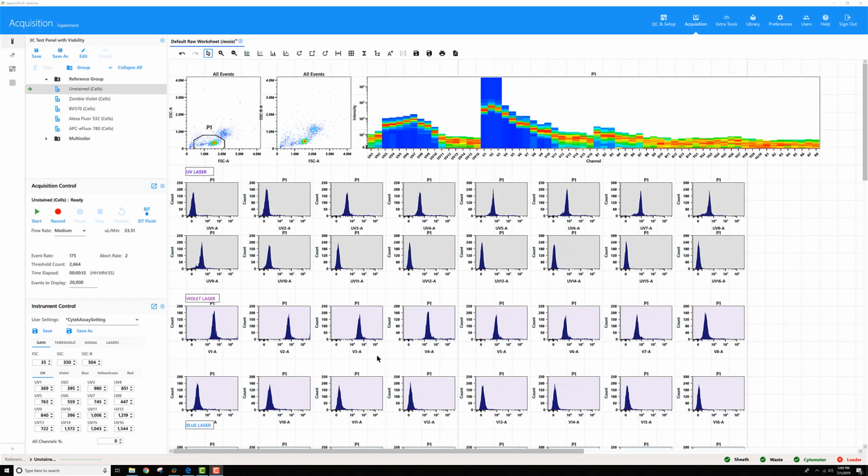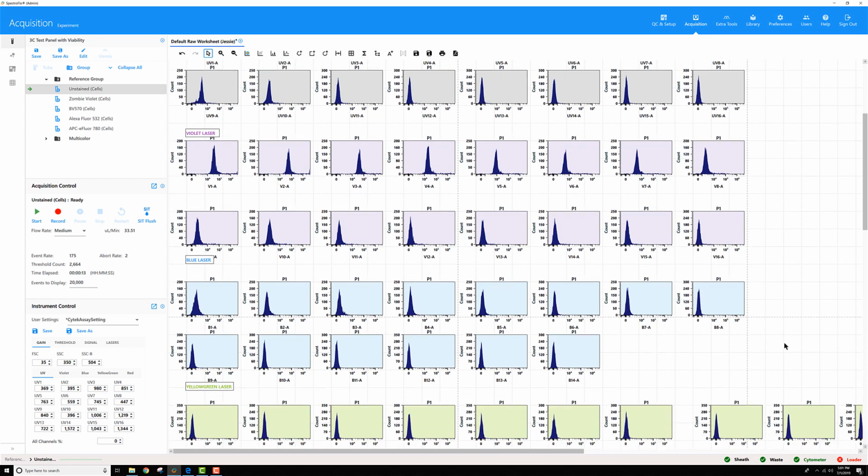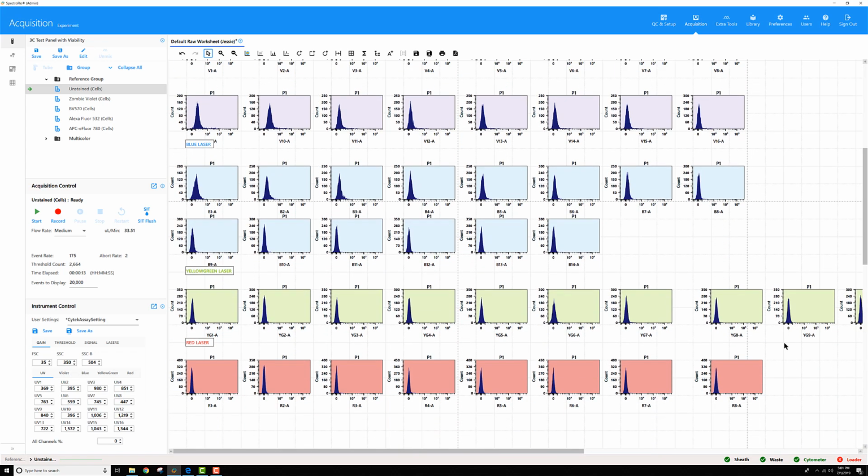If you've ever been in this scenario, where you've been previewing one of your user's control tubes and you notice, oh wait, a lot of the positive events are really, really high on the scale and are saturating my axis. You know you can't unmix with this, as your data is going to be all stacked on the axis as well and difficult to interpret. So you're going to have to make an adjustment to the Cytek assay setting.